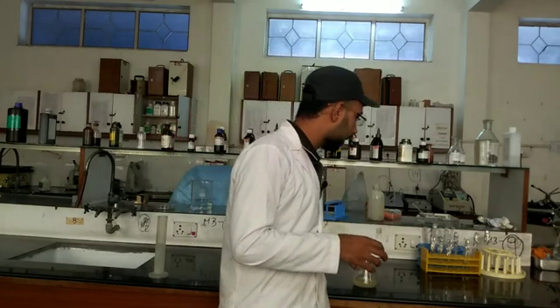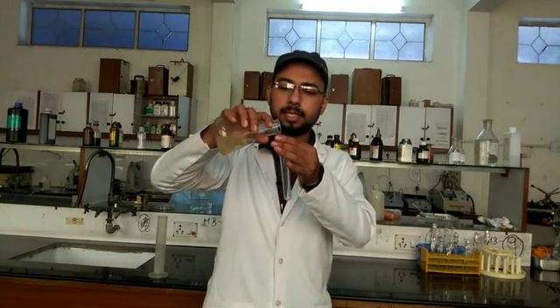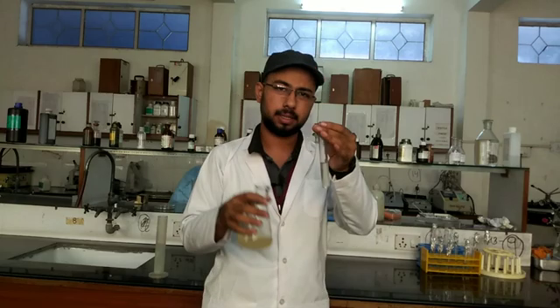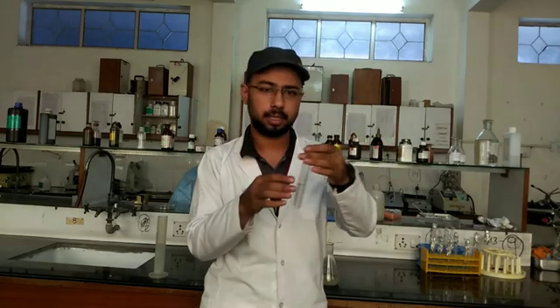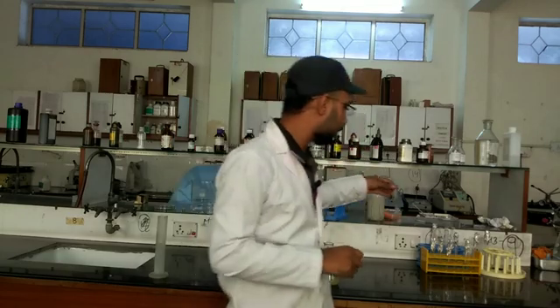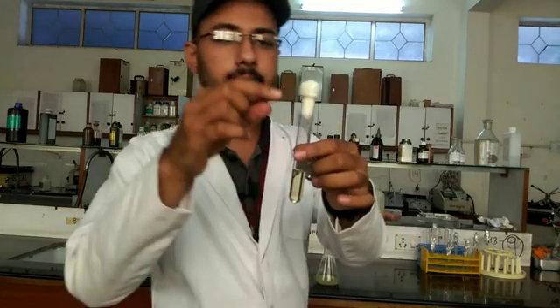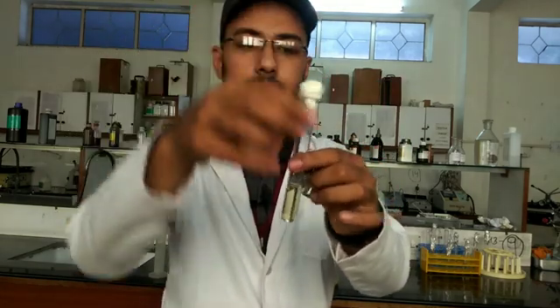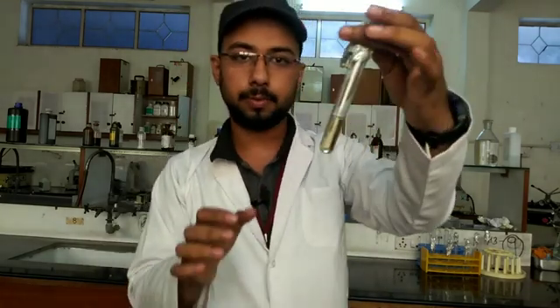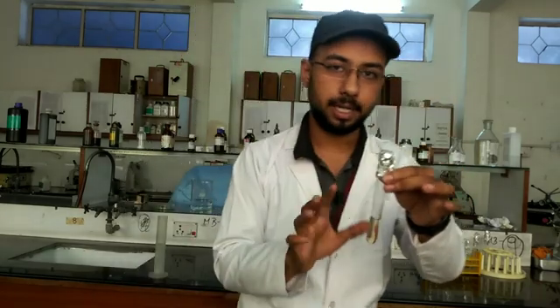Once homogeneous, take some test tubes and fill each up to approximately 10 ml of the nutrient broth. After filling, cover each test tube with a cotton plug and then wrap it with aluminium foil.